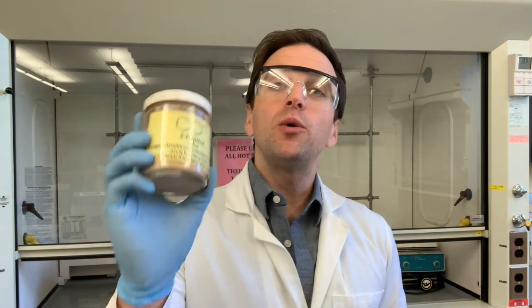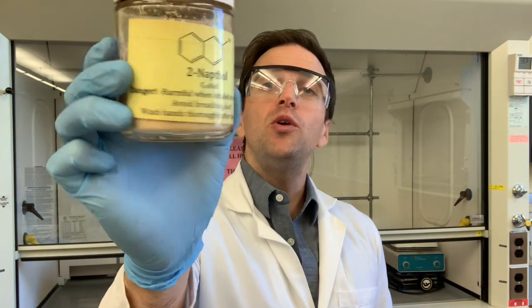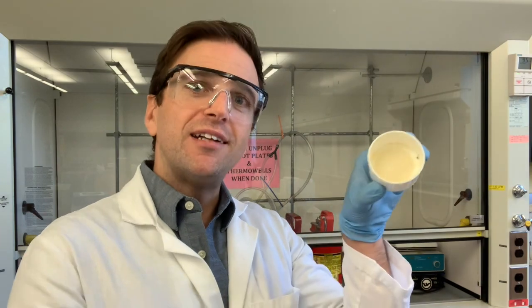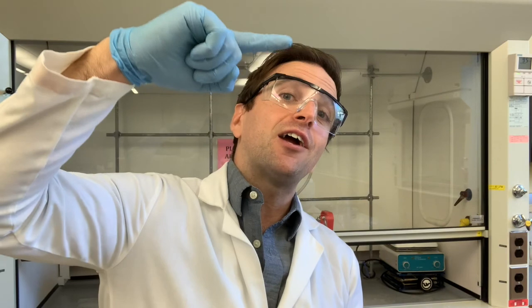Using the power of organic chemical synthesis, we were able to transform 2-naphthol right here into this product right here. And at this point, we don't know the identity of this product. TLC tells us that it's certainly not 2-naphthol. It has converted into something else, and based on the TLC, the fact that it had a higher Rf value means it's not as polar as 2-naphthol.